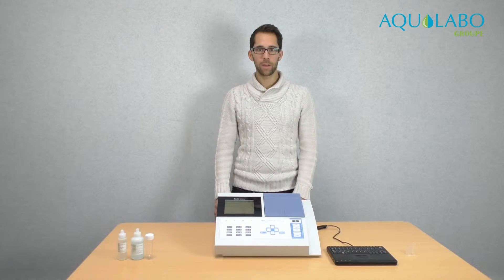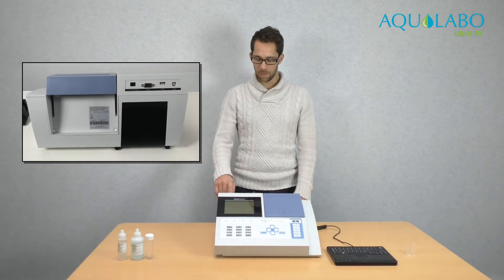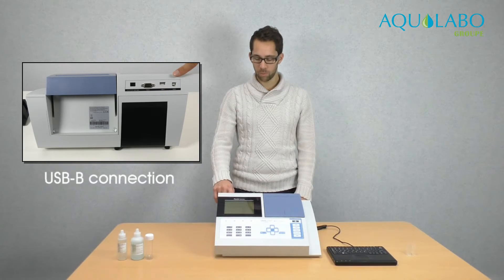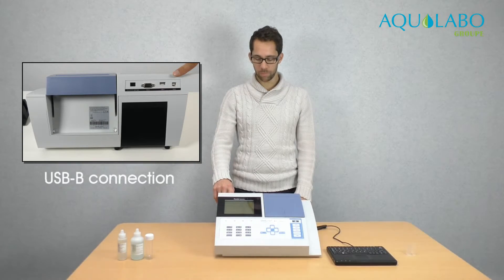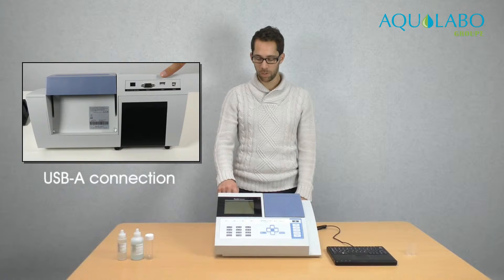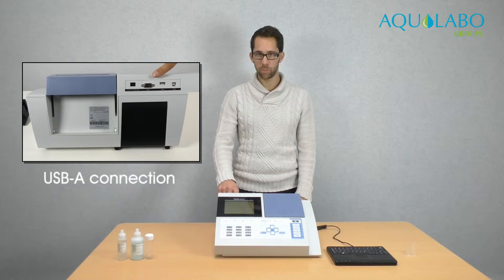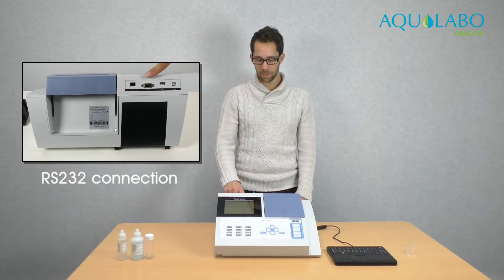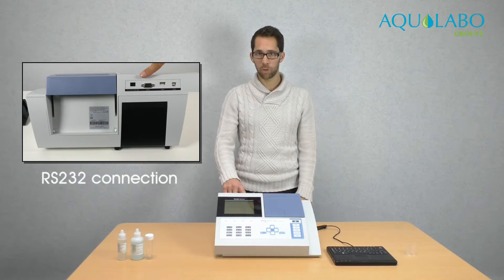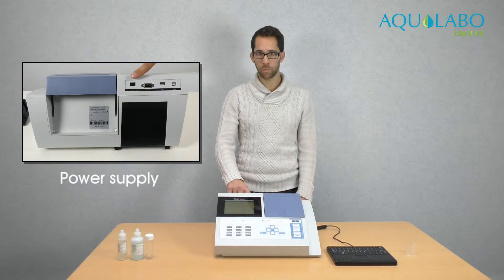At the back of the device there are the connections. There is a USB-B connection to plug a computer, a USB-A connection to plug a keyboard or a USB stick, a RS-232 connection to plug a printer, and a power supply.